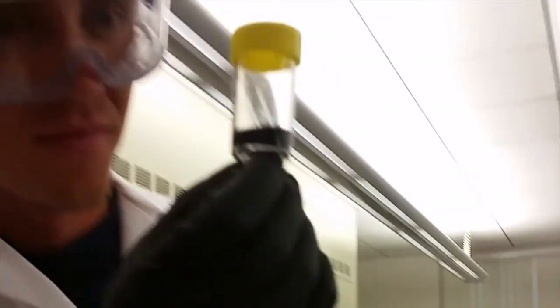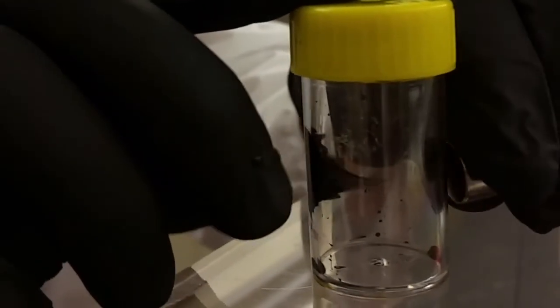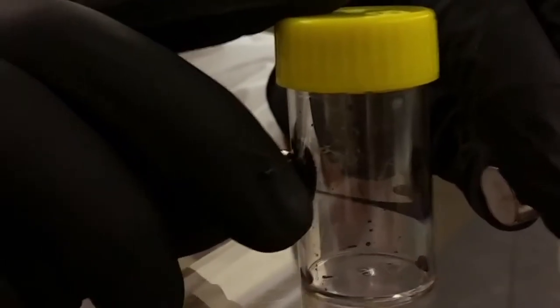Once you've finished synthesizing your ferrofluid, place the lid on the container and don't remove it until you're ready to dispose of the ferrofluid. Be creative in the activities you come up with to explore the properties of the ferrofluid and have fun.